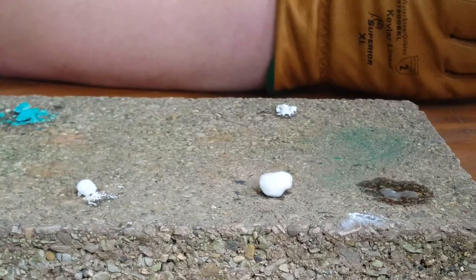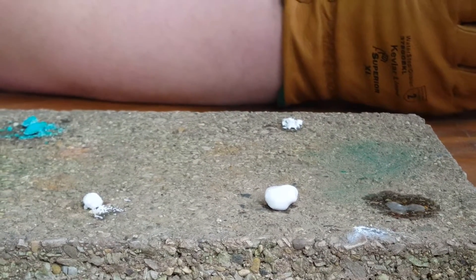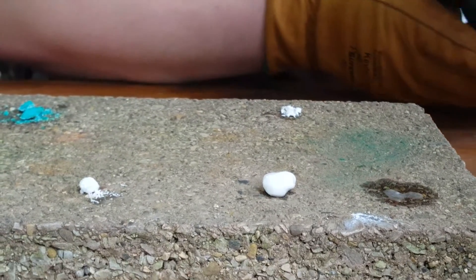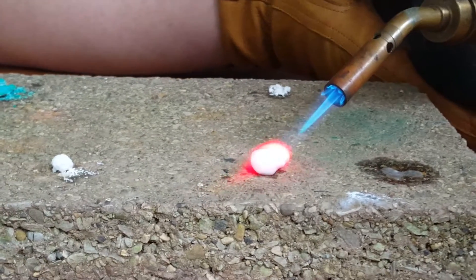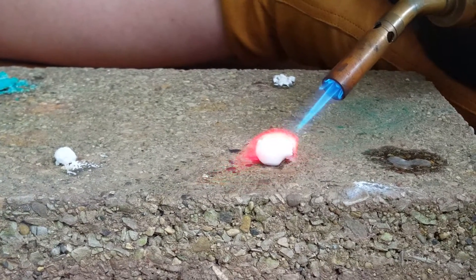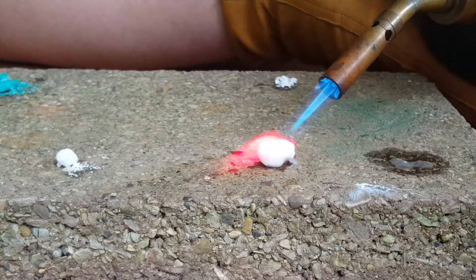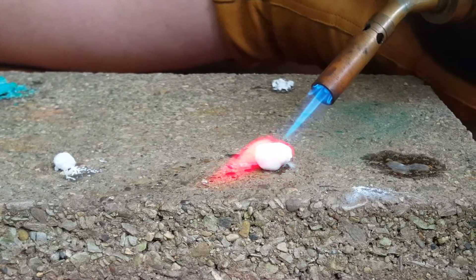The first metallic salt we are going to be lighting is lithium chloride. As you can see, this burns with a bright pink-red flame.